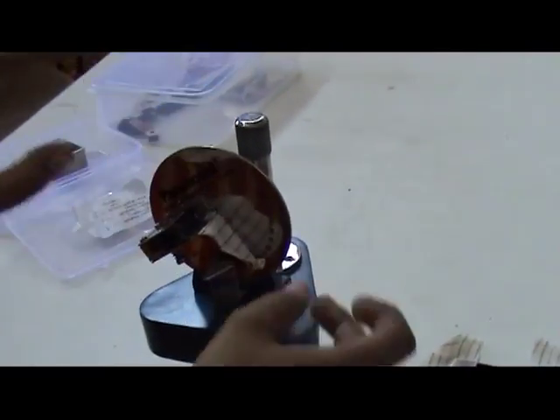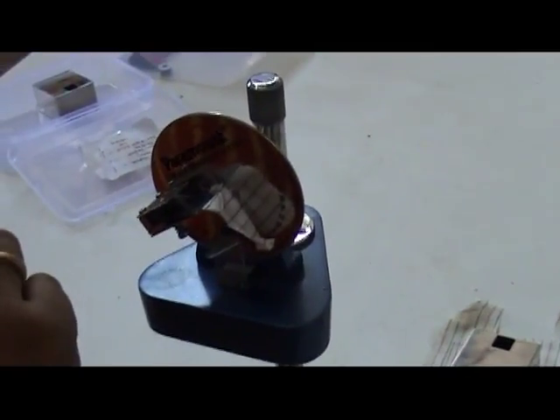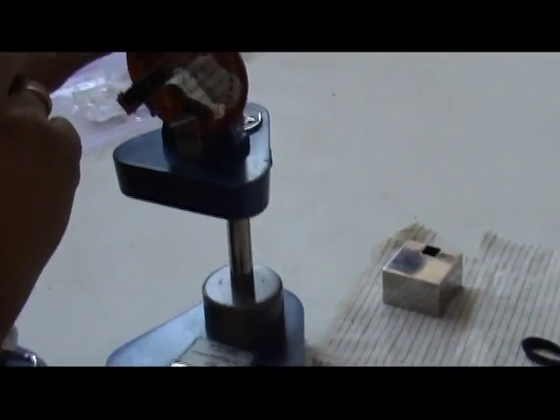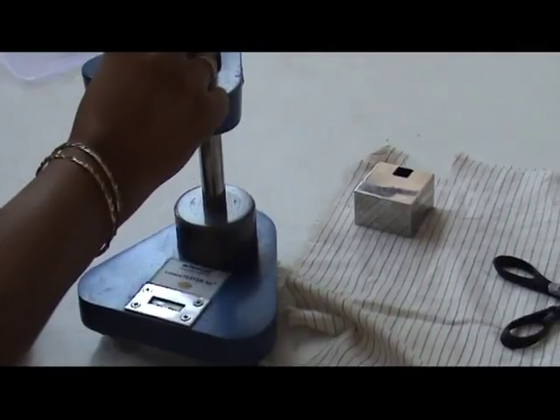the crease recovery angle to the nearest degree is reported for the warp way and weft way test specimens.